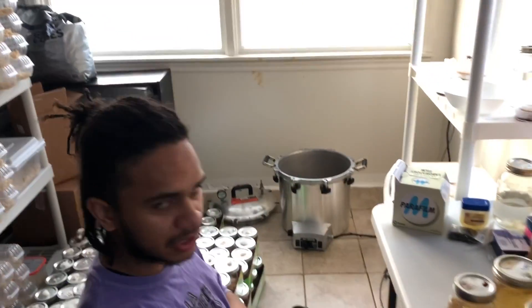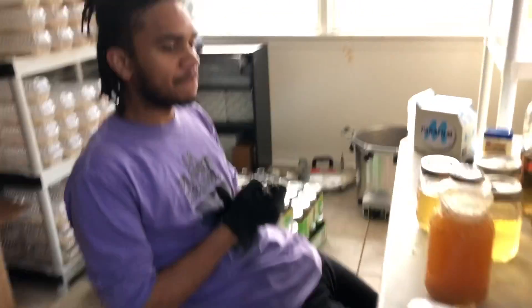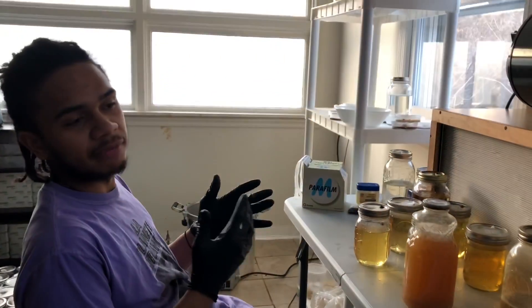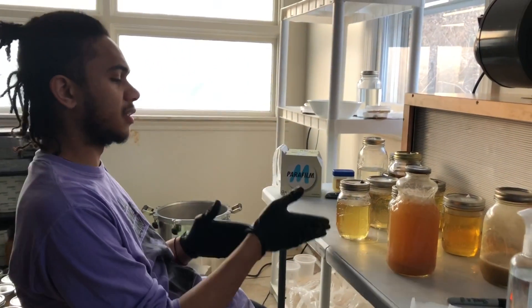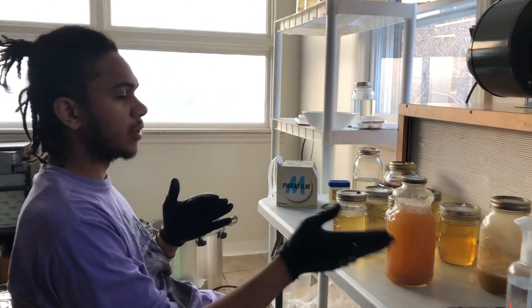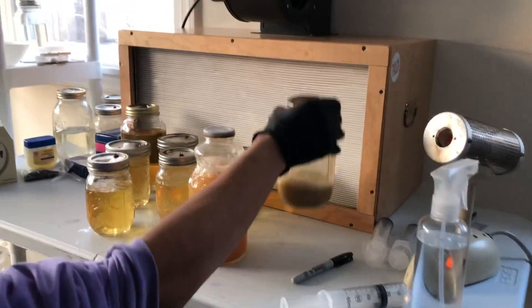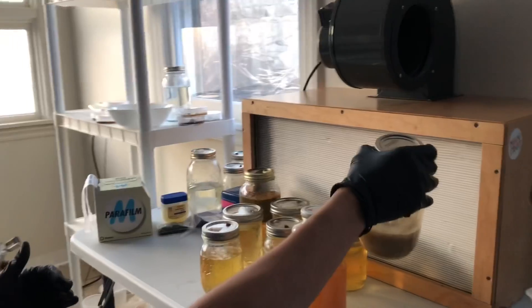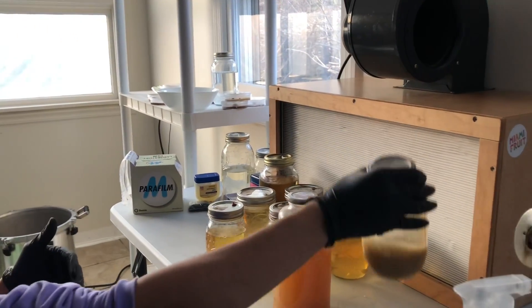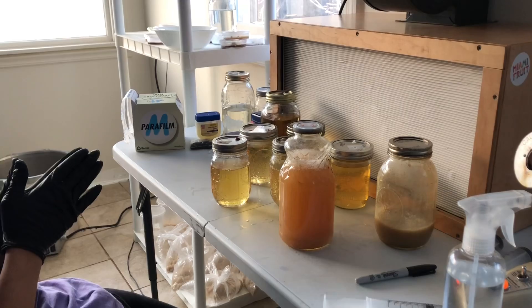It was in the All-American Electric Sterilizer there for 30 minutes at 10 psi. I'll repeat from the previous video — I do that to make sure that the sugars in the liquid culture do not caramelize. I also run my agar at the same pressure for the same amount of time. I have some old agar here that I didn't use up last time, so I did that again and I made some new agar to fill up all the petri dishes that I need to use this time.